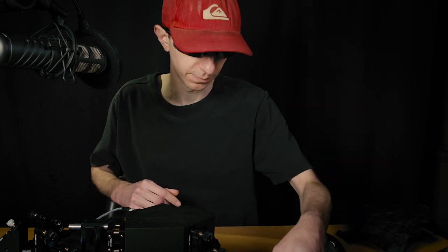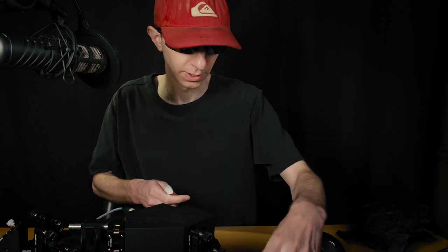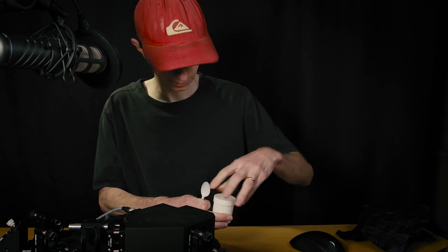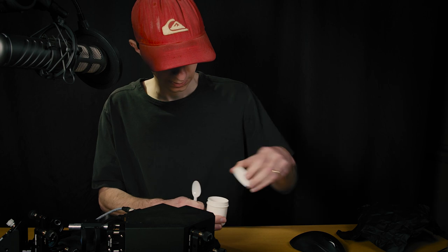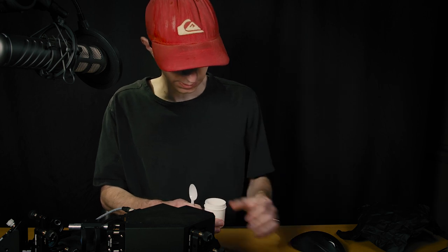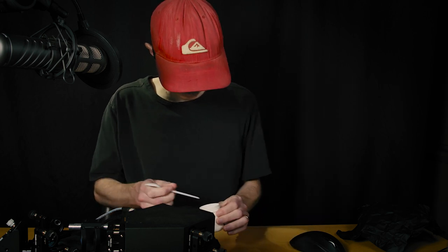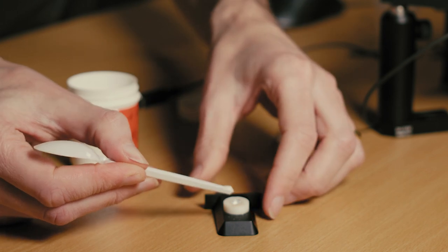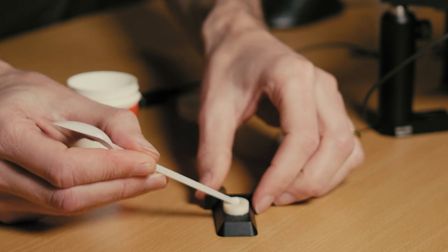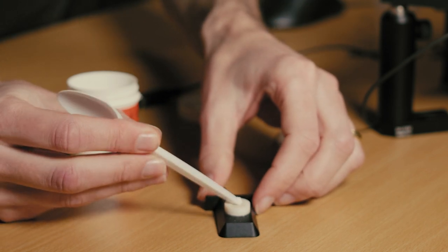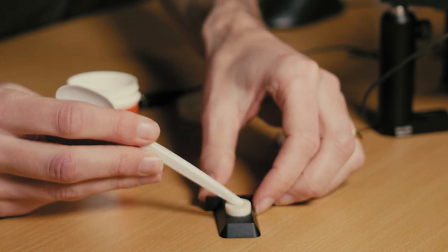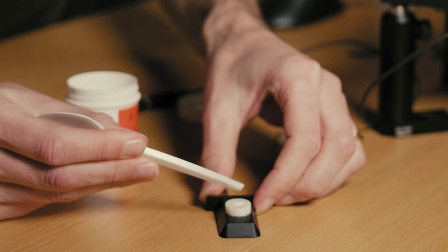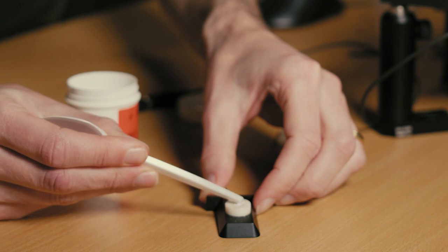And I will take some salicylic acid. This is analytical grade by the way, so it should be pretty pure. You only need a really small amount of powder for this sample.